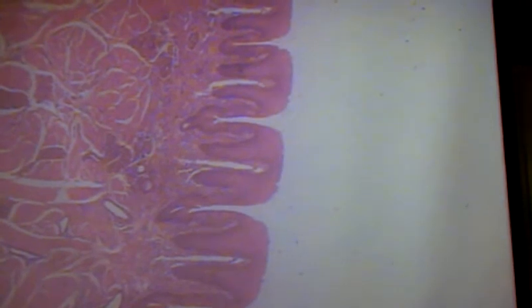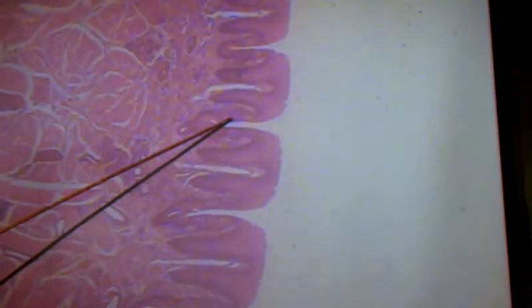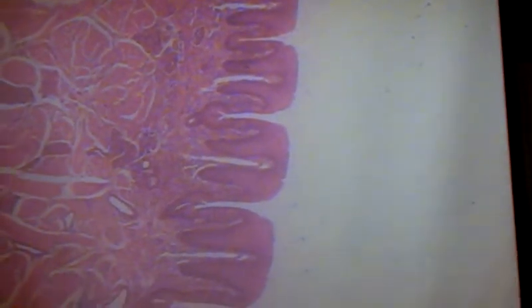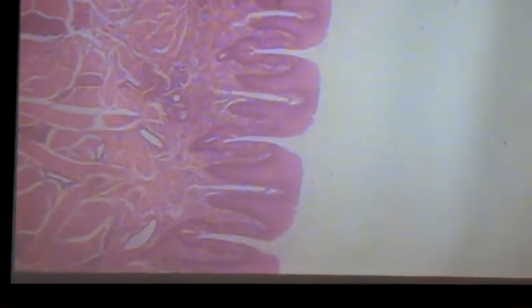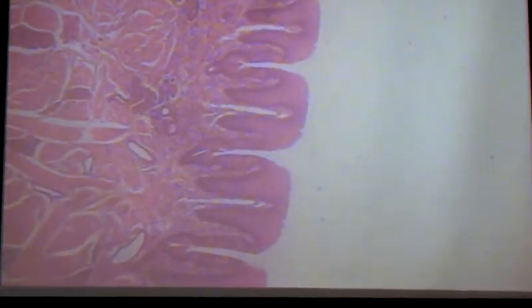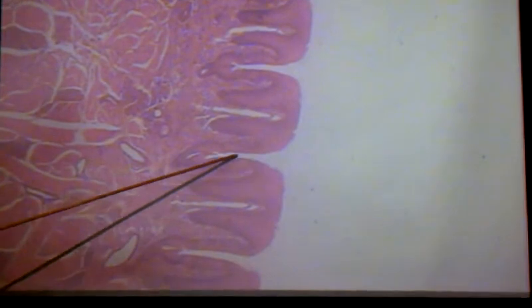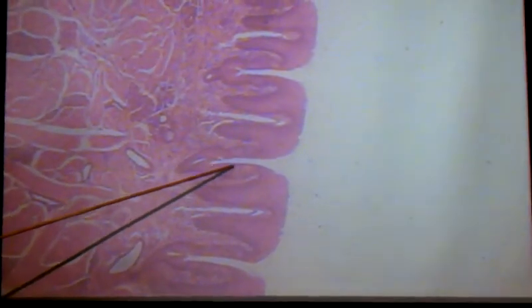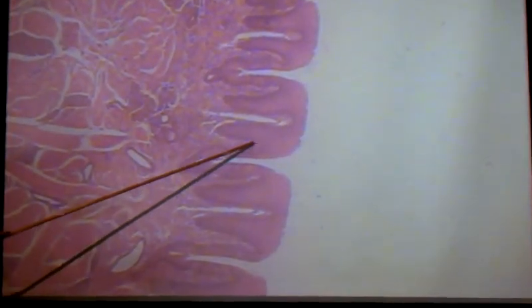So what we have here is the surface of the tongue. This is a papilla. This is a papilla. This is a papilla. That's what you're looking for, okay? The taste buds are in the crevices between papillae. So on my slide, it's not stained very clearly, but in this crevice right here, on the side of the papillae, are little roundish to ovalish looking structures that are the taste buds.